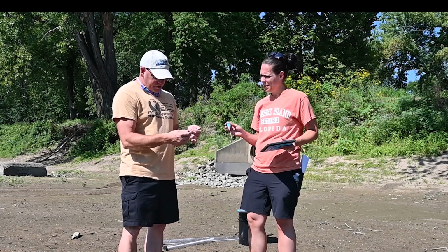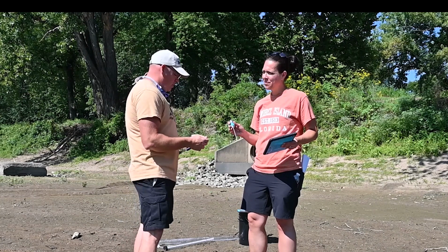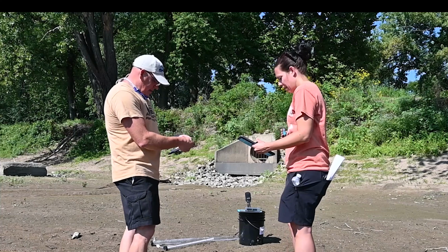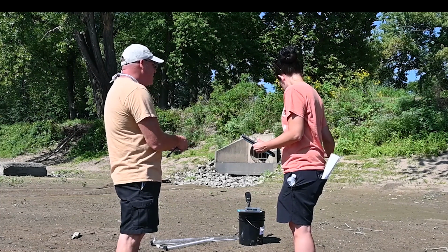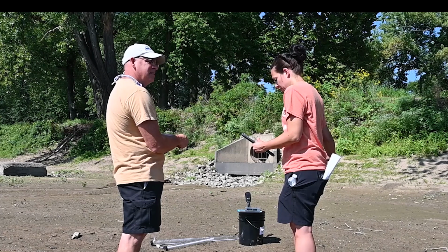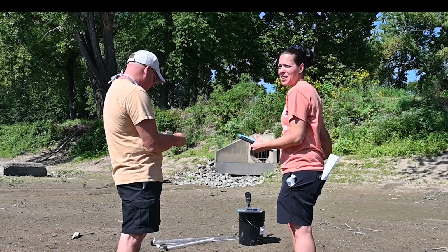Now, what's our air temperature? Oh, we've got to shade it with your body, so the sun's not affecting it. Yep. Hold it here for a minute. Then what's the air temperature getting to be here? Mine's reading right at 29 degrees Celsius.